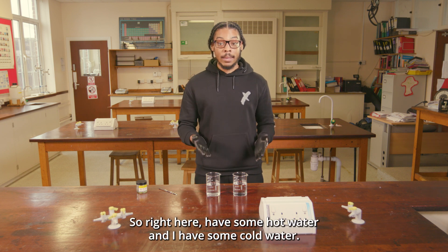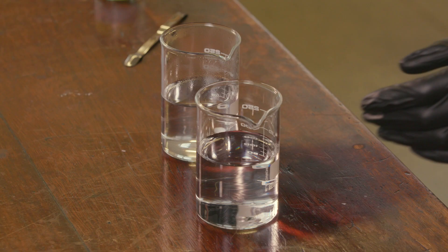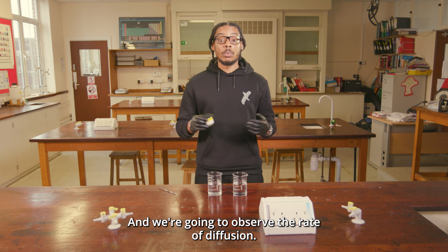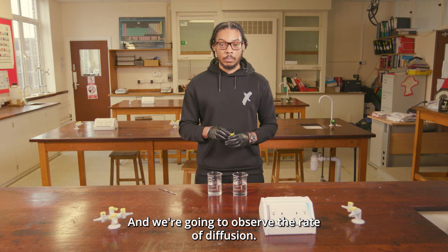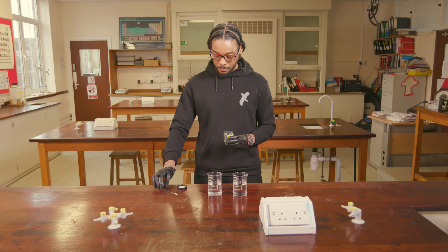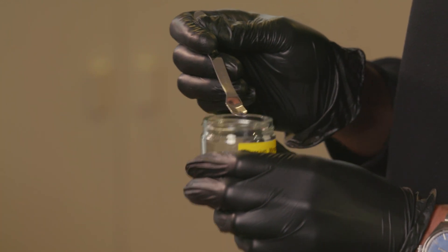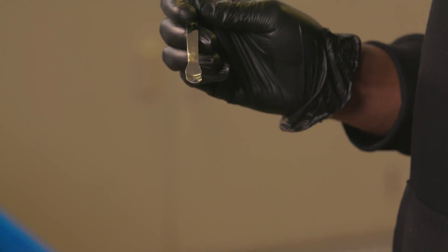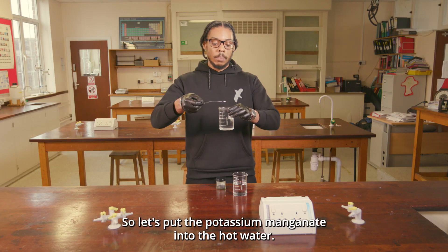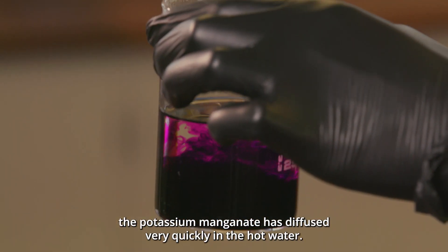One of these factors is temperature. Here I have some hot water and some cold water, and we're going to put some potassium manganate into each and observe the rate of diffusion. Let's put the potassium manganate into the hot water.